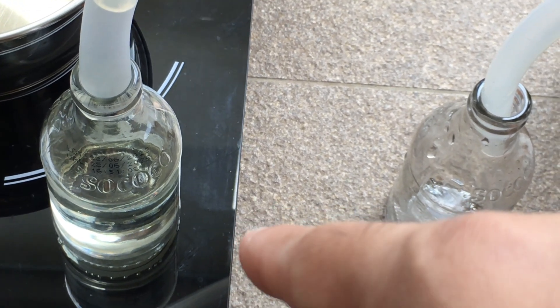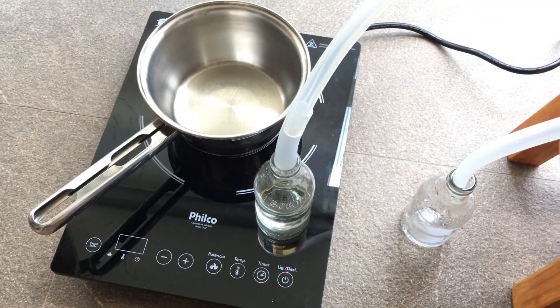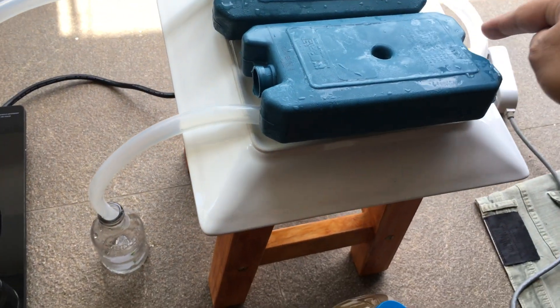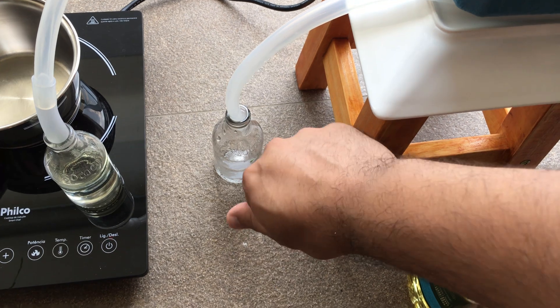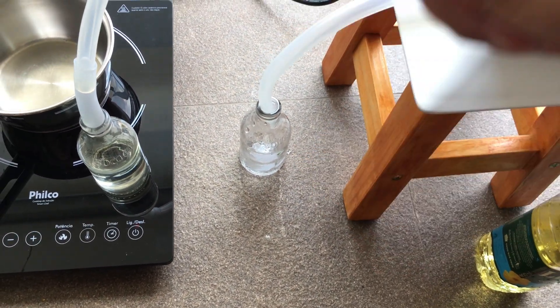I have a digital thermometer which I'll be using. You'll see it heat up, go through the cooling — just a simple U-turn — and then into a clean vessel. It has some water but I'm not worried about the water content.